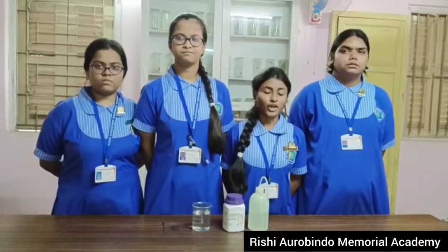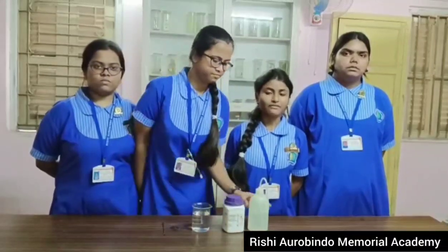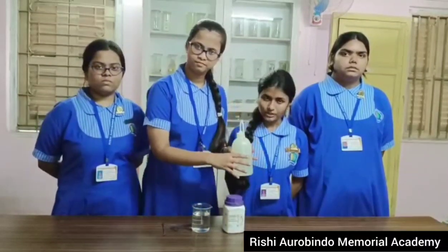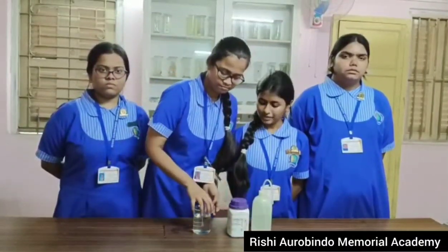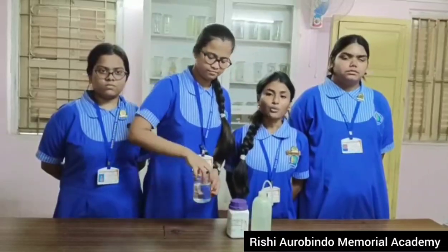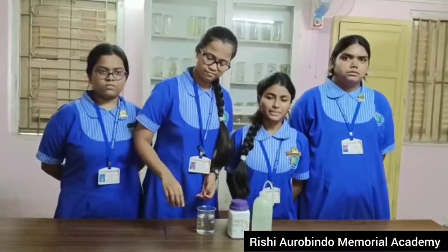we are going to perform a simple experiment on diffusion. As we know, diffusion is the process where molecules move from higher concentration to lower concentration. For this experiment, we have distilled water, potassium permanganate, a beaker, a watch glass and a spatula.